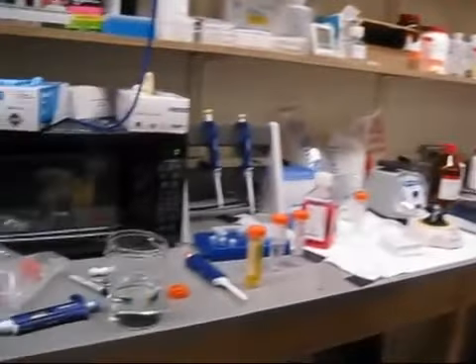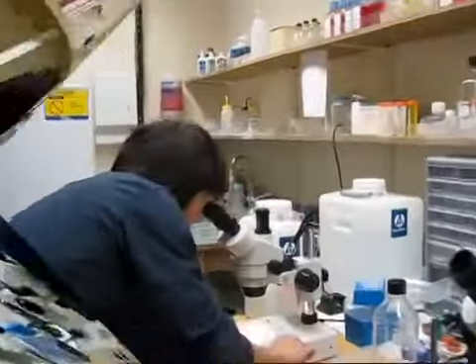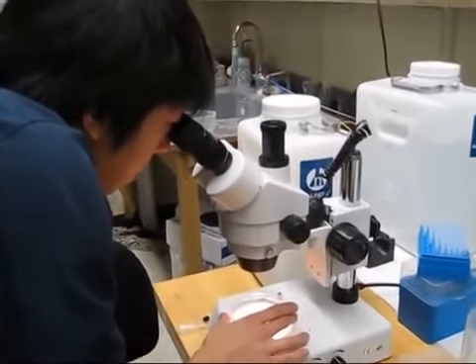1 week. And we have some that were 2 days old. So we can show them a small video screen or an LCD screen and create different patterns of illumination, spots, moving bars. These are the kind of typical things that have been done in similar fields in mammalian models, and look at basically evoked activity due to different types of stimuli.